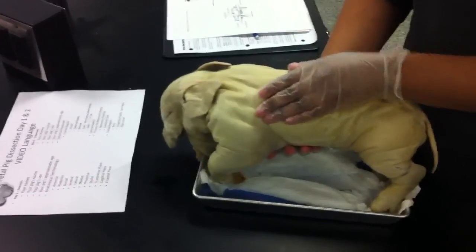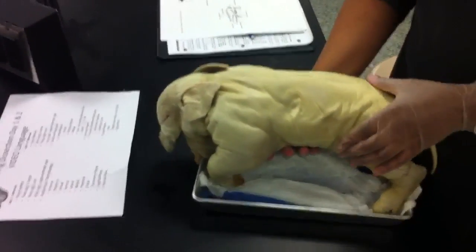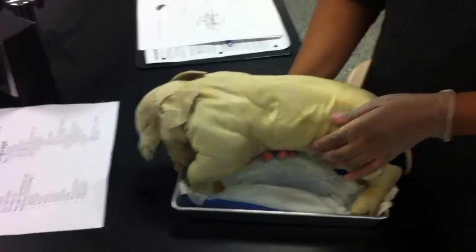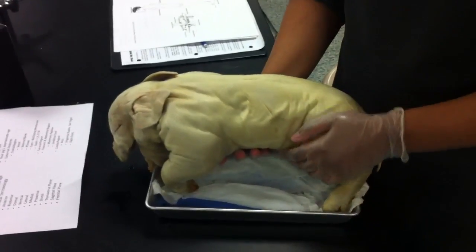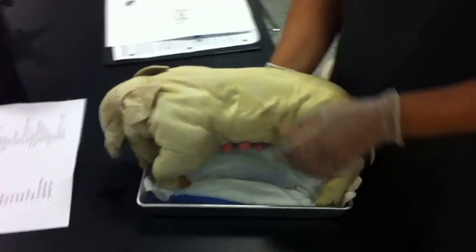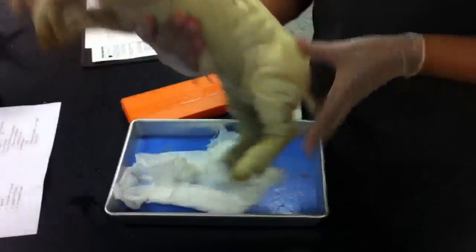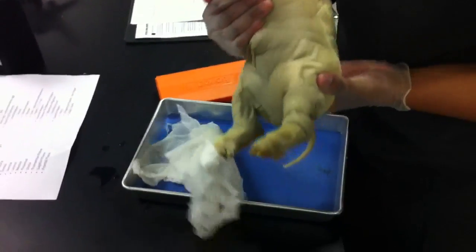I'm Skyler and this is Galilee. Our pig's name is Ferdinand. He is 49 centimeters long. He is a male and he is full term.